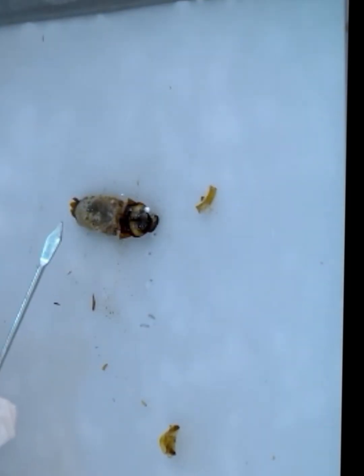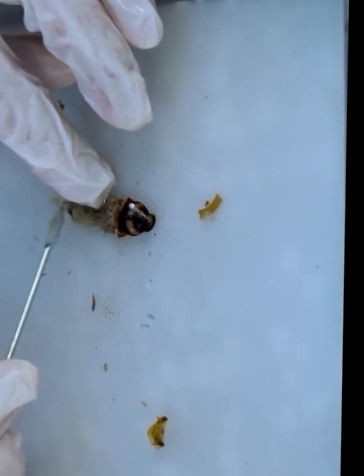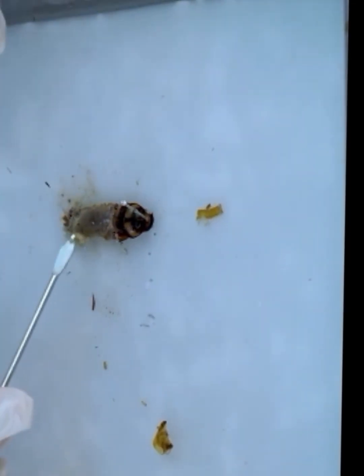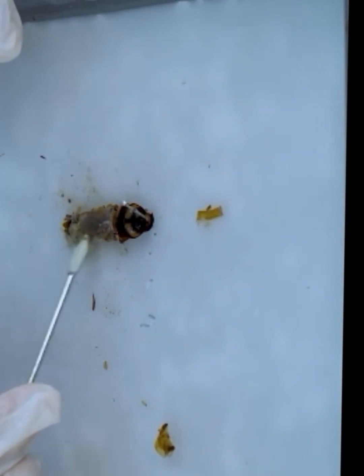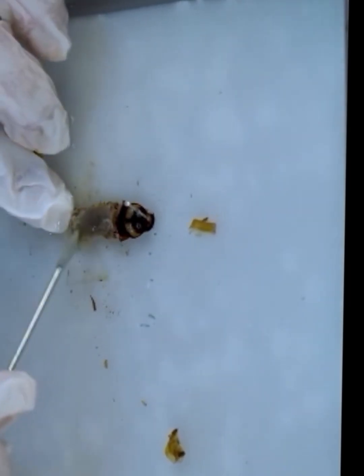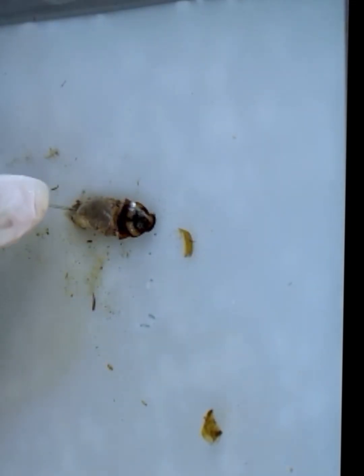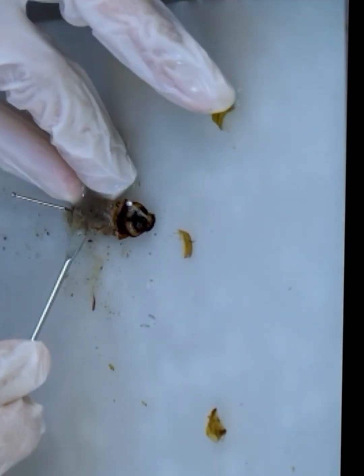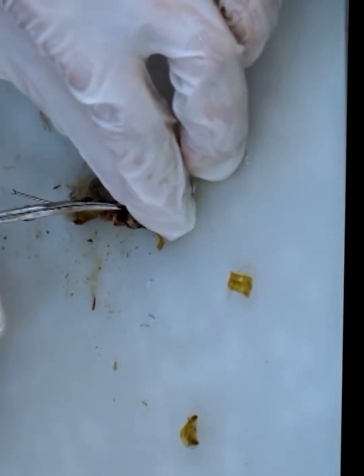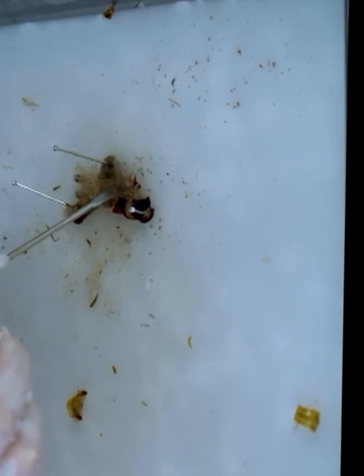After removing the dorsal exoskeleton, we will observe several internal structures in the body cavity of the cockroach, and among these structures, the fat body is a very noticeable tissue. The fat bodies are very soft, yellowish, or you can say whitish tissues, and they are present inside the body cavity. They surround and support many internal organs, including the reproductive system and digestive system. The main function is to store reserve food material.